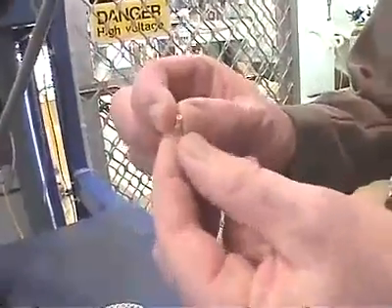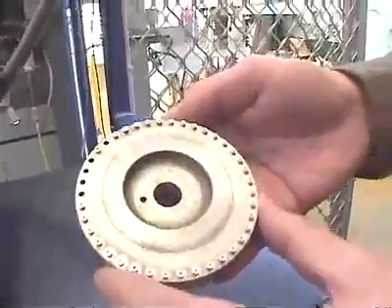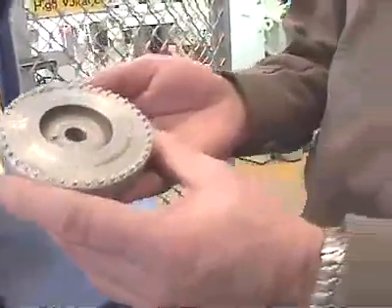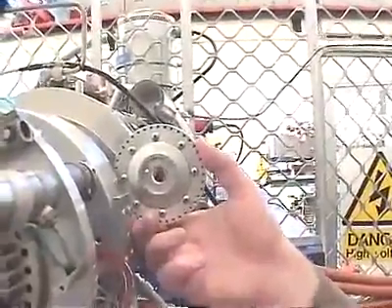Hello, I'm Roger Sparks. You've seen how the laboratory turns the sample we want to date into a piece of graphite. Now we're going to see what happens to that graphite. We bring it over to this laboratory and we pack it into this little aluminium pin, which is called a target holder. The target holder can then be placed into a wheel like this. We can have 40 sample holders in that wheel, which means we can date 40 different samples at the same time. The wheel will get placed inside this device here, which is called an ion source.